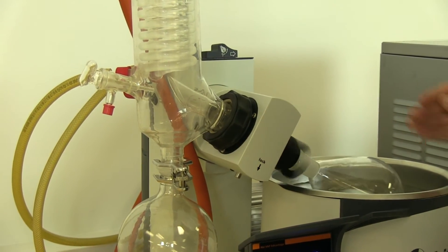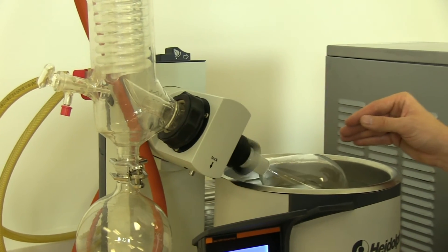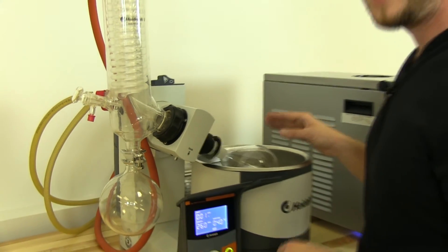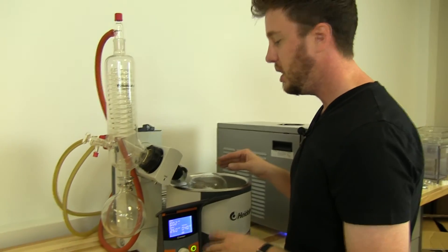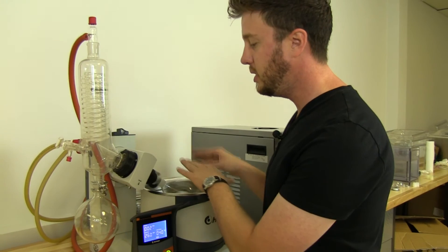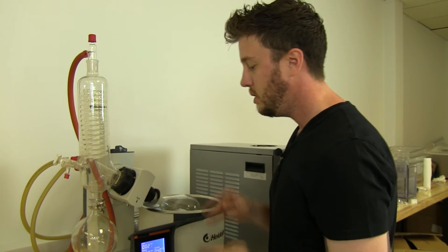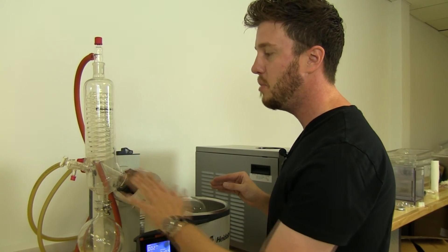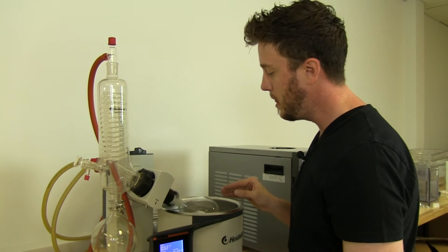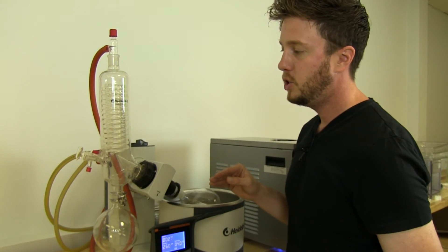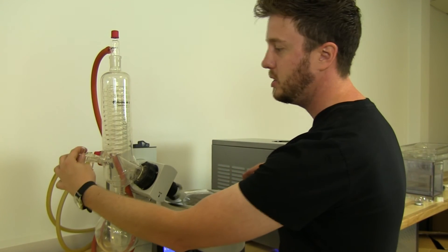Distillation, generally for about a liter at 40°C, give or take, will take two to three hours to get a proper concentration or distillation on this side. You can certainly run it a lot lower. You can bring your vacuum level a little bit lower as well. Simply just open it ever so gently on the stopcock here.